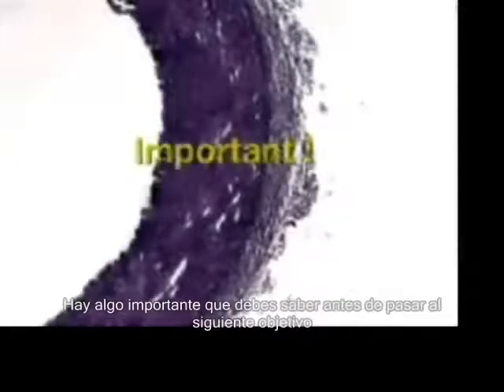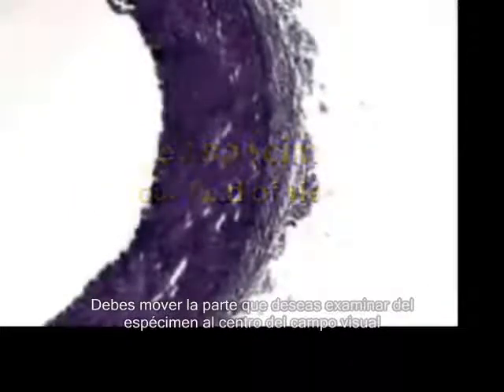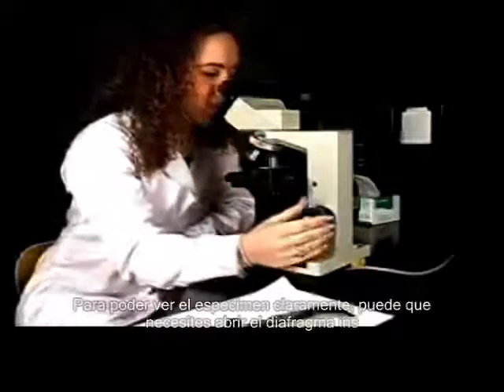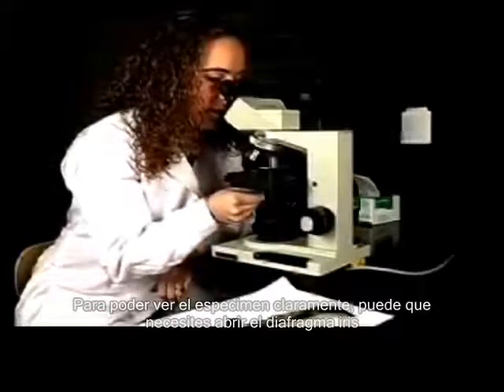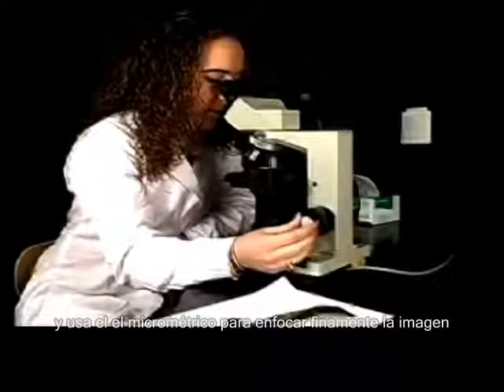There is one important thing that you must do before going to the next objective. You must place a desired part of the specimen in the center of your field of view. We can now move to the 10x objective. In order to see the specimen clearly, you may need to increase the light by opening the iris and using the fine focus to get a sharper image.